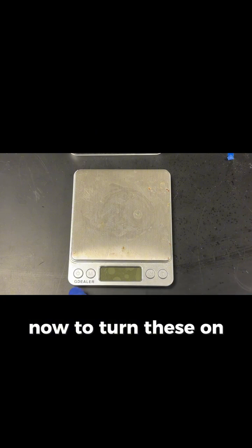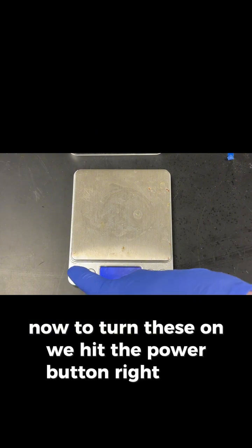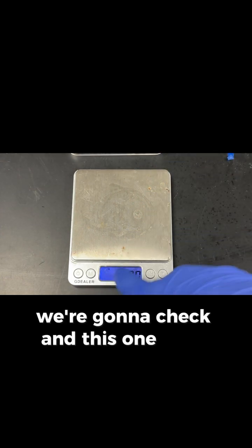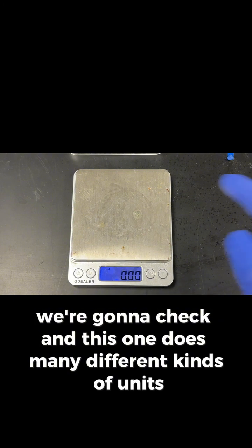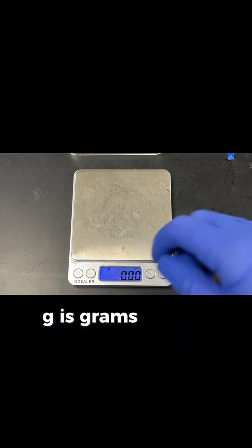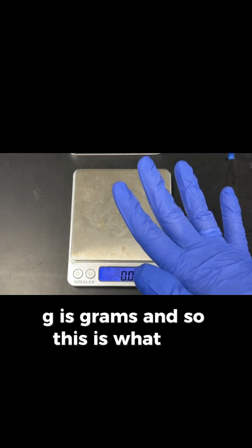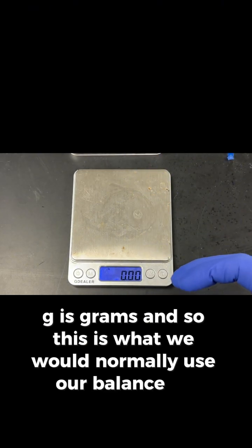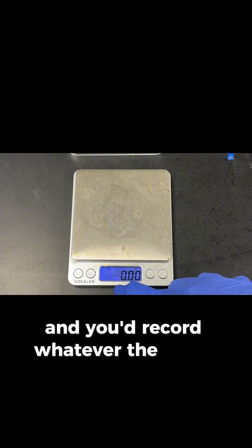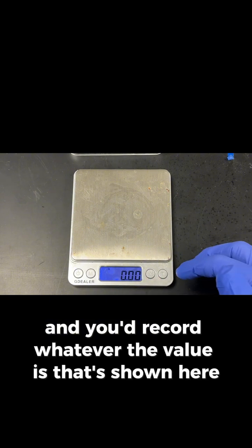Now, to turn these on, we hit the power button right here, and now it shows 0. We're going to check, and this one does many different kinds of units. So I am currently in grams. G is grams. And so this is what we would normally use our balance for. We'd measure it in grams, and you'd record whatever the value is that's shown here.